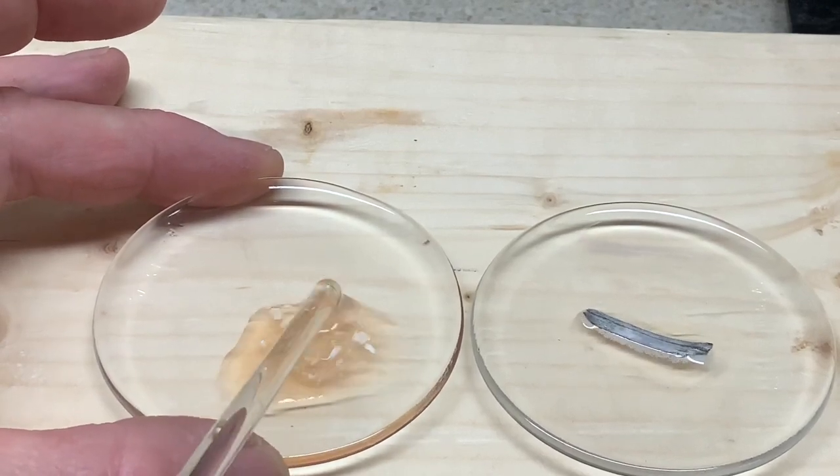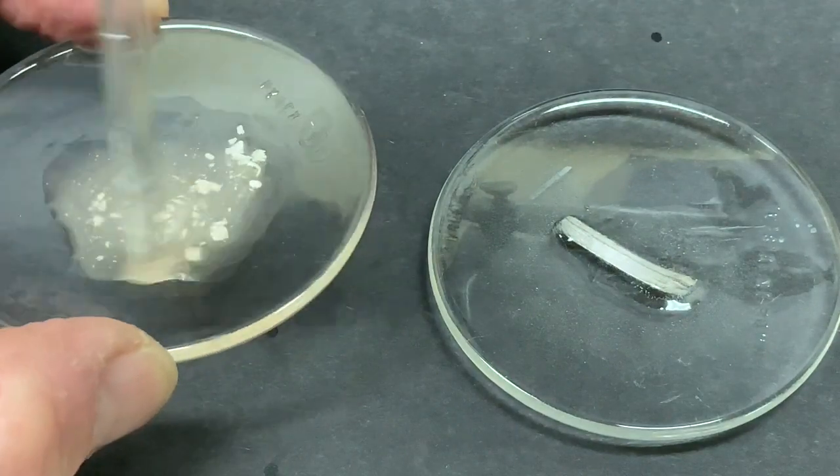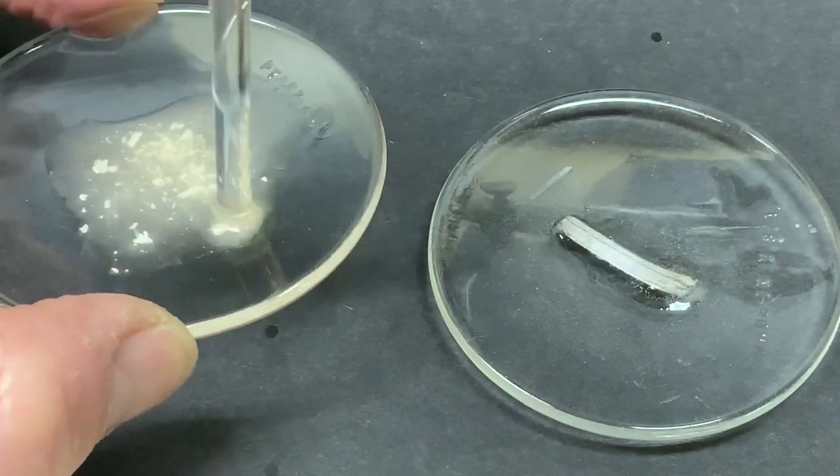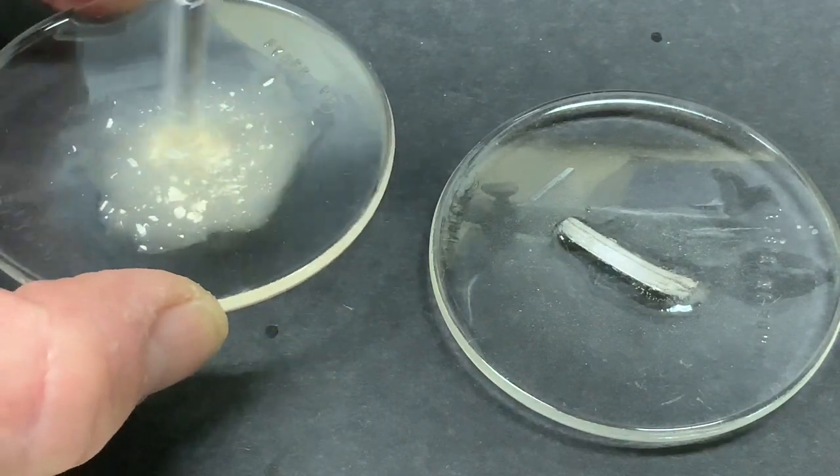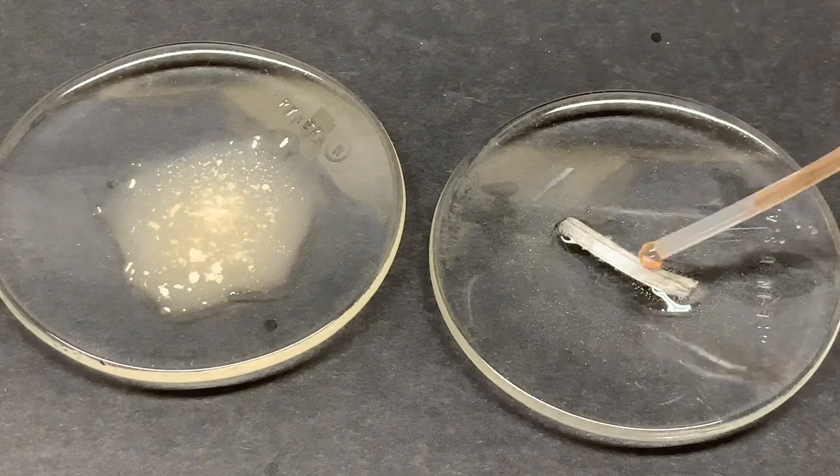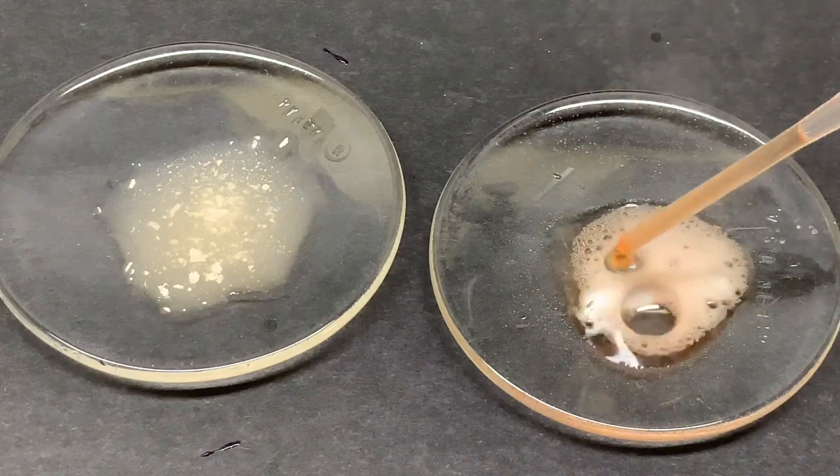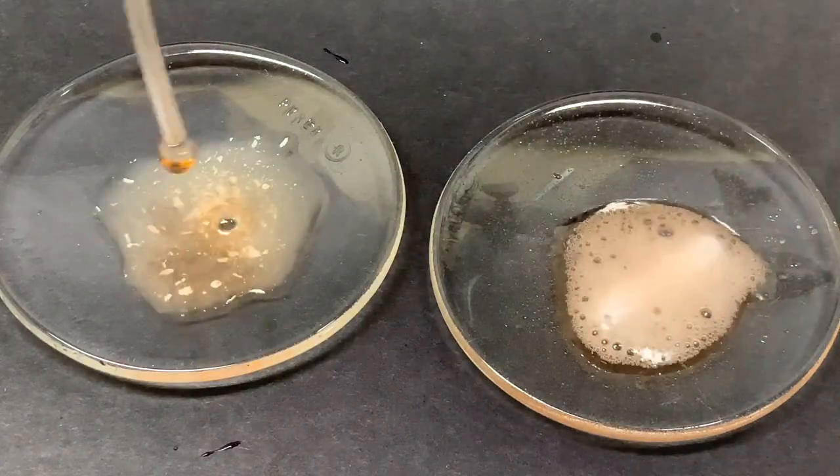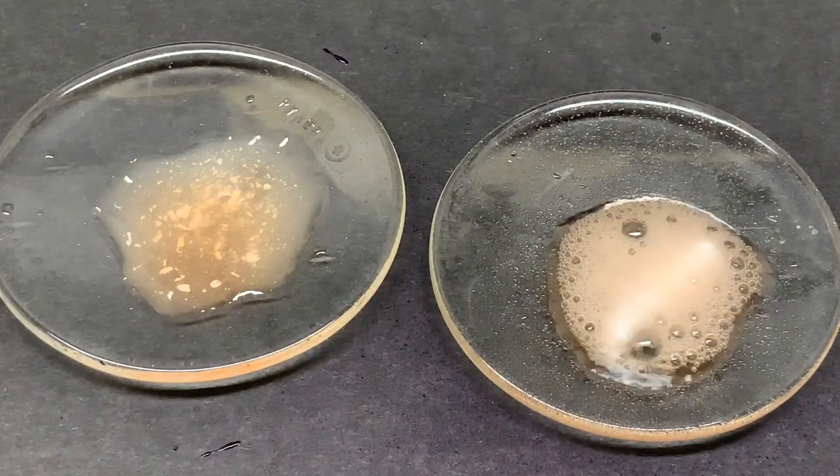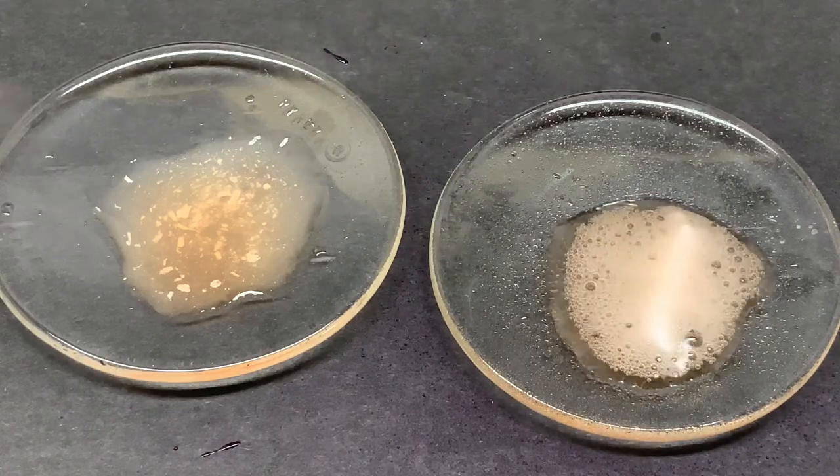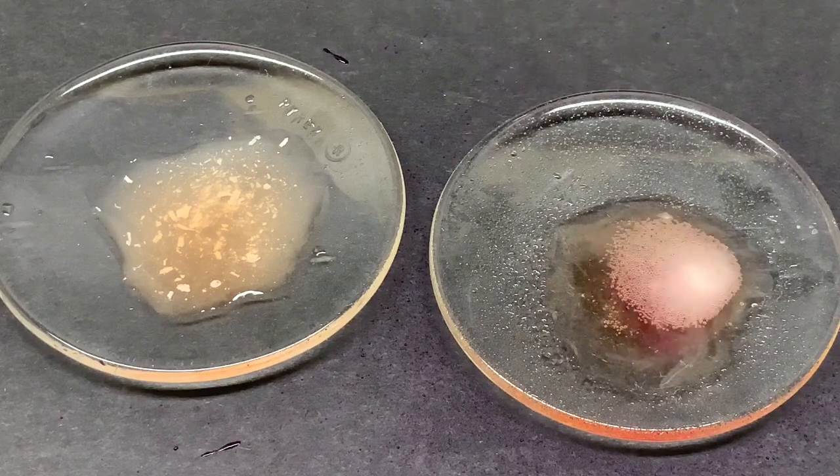There's quite a difference. In fact, not much of a reaction appears on the left side, but upon stirring notice that the solution turns a bit cloudy, which gives an indication of what might be going on as the magnesium oxide interacts with the water part of the aqueous HCl. Stirring more, and with a black background, you can see the solution is quite cloudy. And watch what happens when more acid is added. I think the acid that I'm using this time has a little bit more red food coloring in it. You can see the reaction of the magnesium on the right generating a very clear solution—yes, it's red but clear—whereas the one on the left is still a bit cloudy until quite a bit more acid is added. Stirring around, I think you'll notice that the solution goes a bit more clear on the left side.